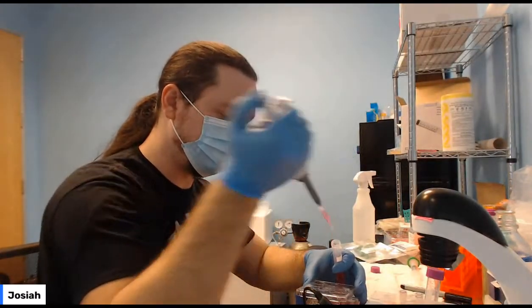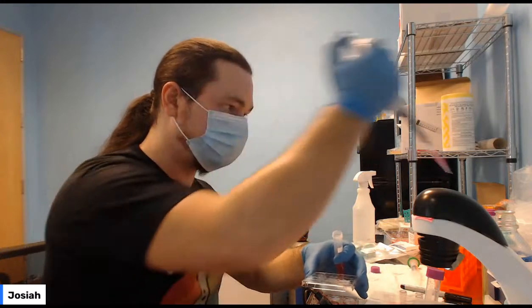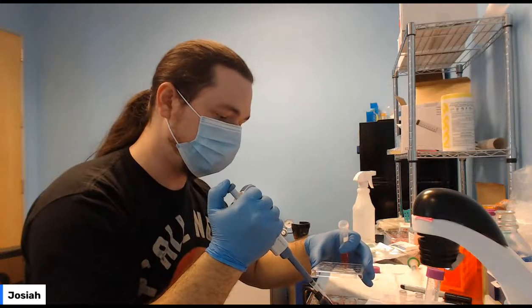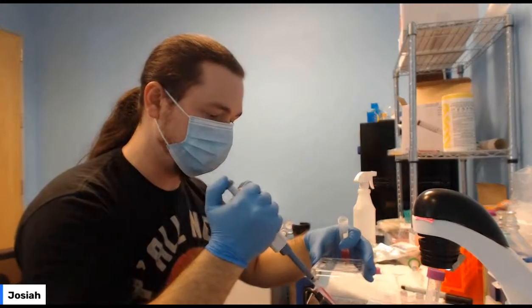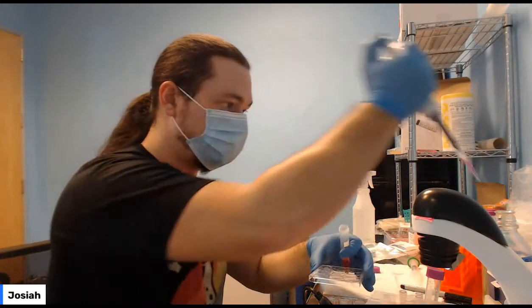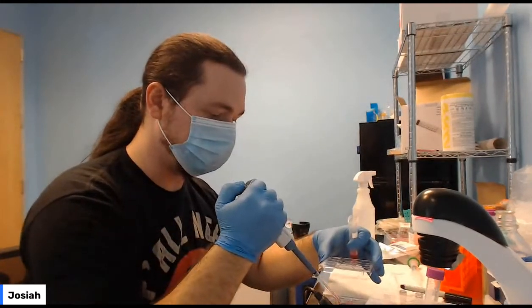And just have something nearby that you can dump the excess liquid in. This will make sure that everything's happening from a really clean place. And you probably want to change tips between all of this. Make sure you don't have any sneaky contamination that winds up in places you don't want it to be.